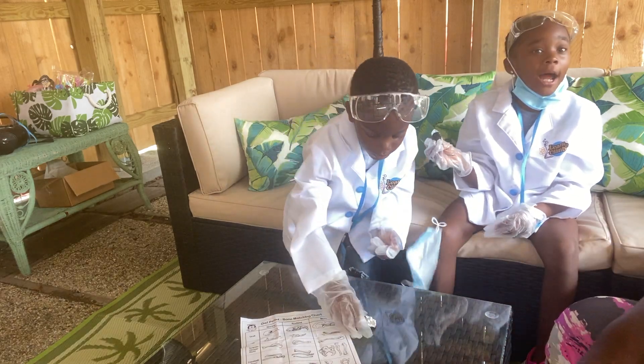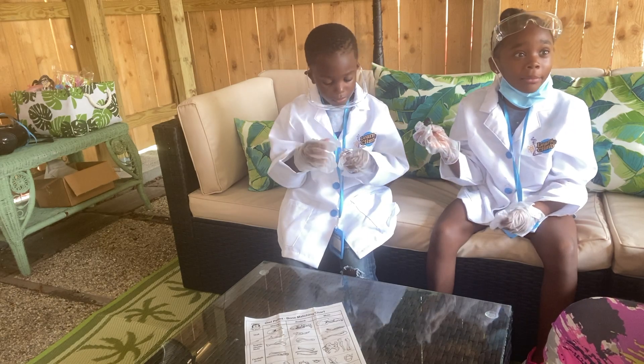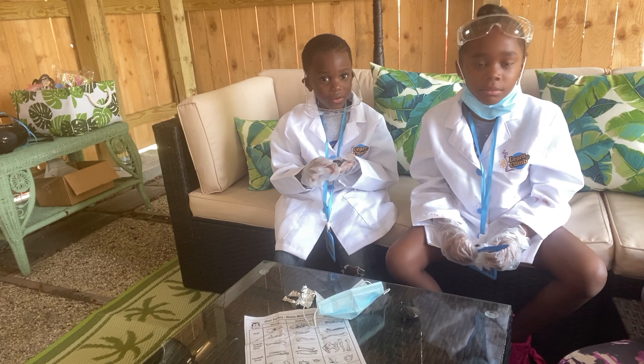If I look at this one more time I'm going to gurgitate! You're going to regurgitate? All right, y'all go ahead and start dissecting it.